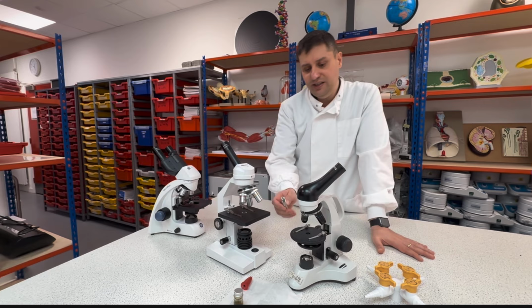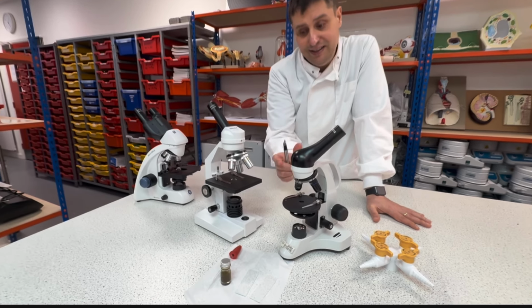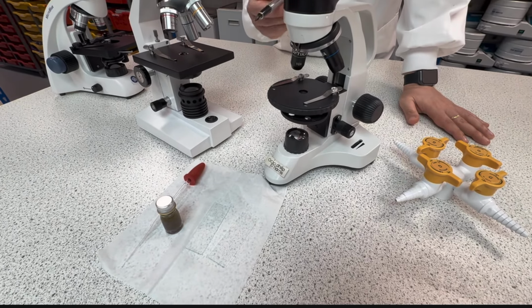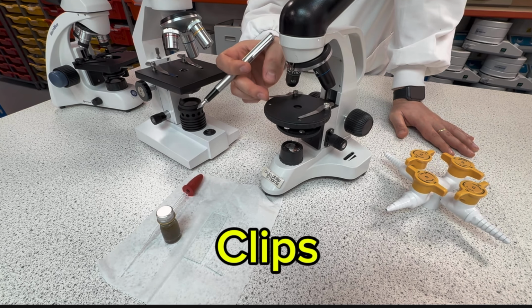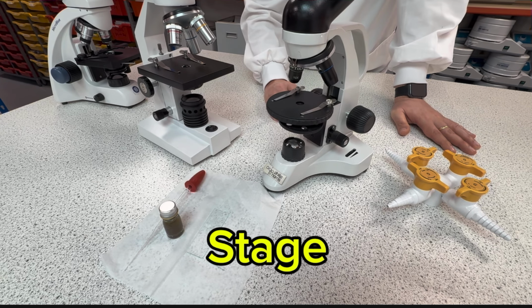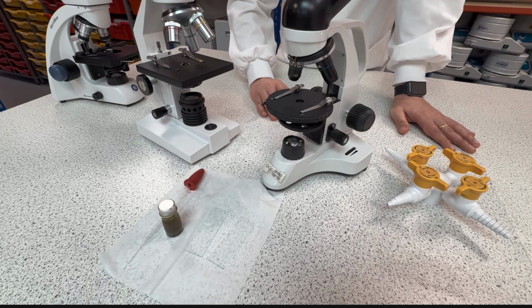So this part here is where I will place my slide. The slide is this glass piece over here, where I'm going to place my sample. This part here is called the clip, where you clip the slide over it. This is the stage where I'm going to place my slide.